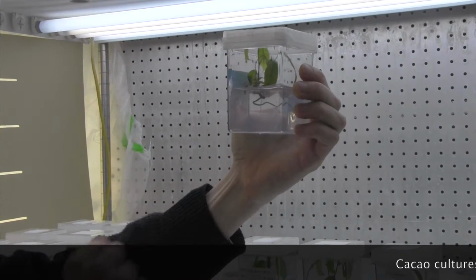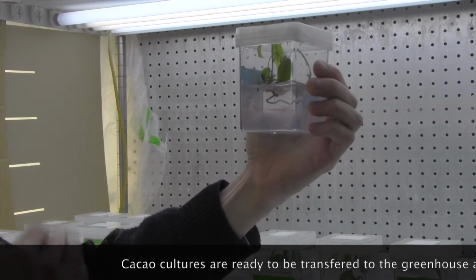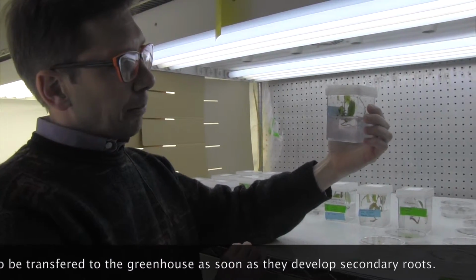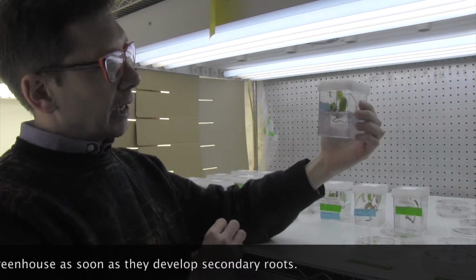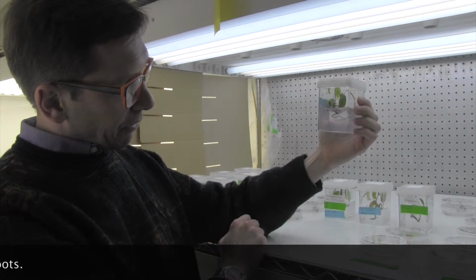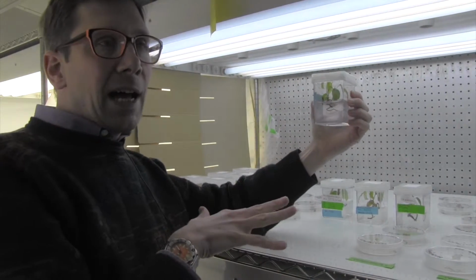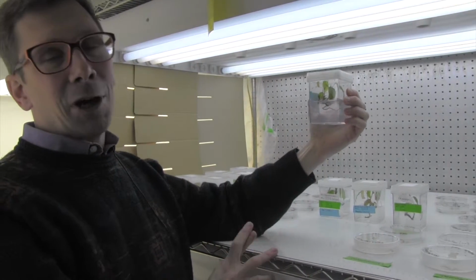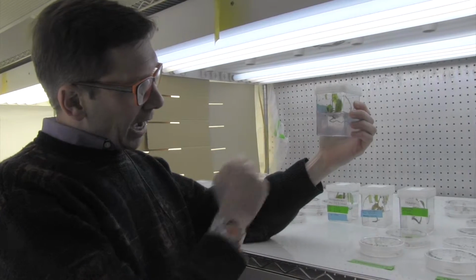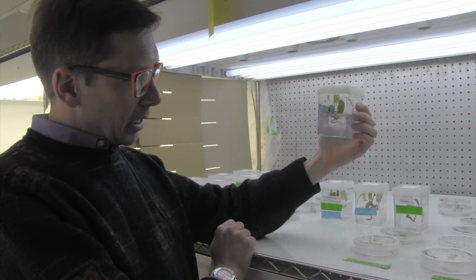Once it starts coming with the secondary root structures, that's when we know that it's time to transfer it to media. Usually it's a perlite or a sand at the beginning, and we take it out of the sterile environment. This is called a magenta box. When we take it out of here, that's the time where it's most fragile. Cross our fingers that it'll survive, because until now it's always been in a closed environment, high moisture, and everything's been taken care of for it.